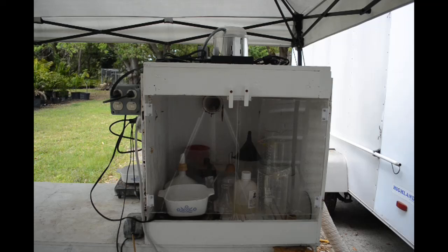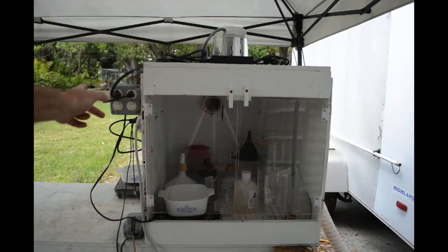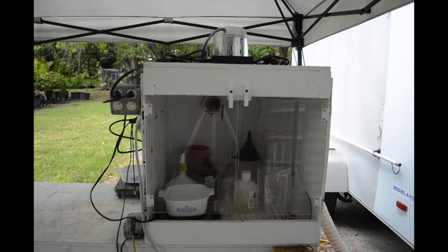I have done some renovation work on it and it's becoming more and more like a professional fume hood. It's working pretty good. Back when I first built this thing a couple years ago I did pretty much everything wrong with it except building the box.